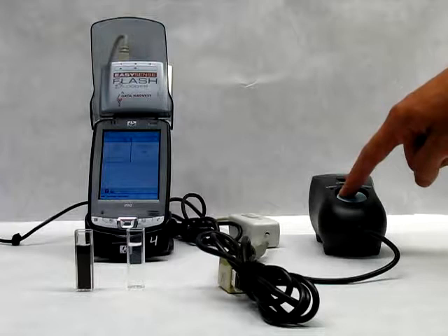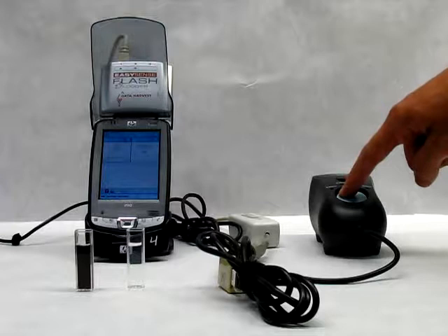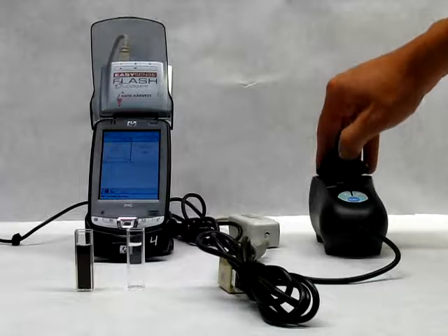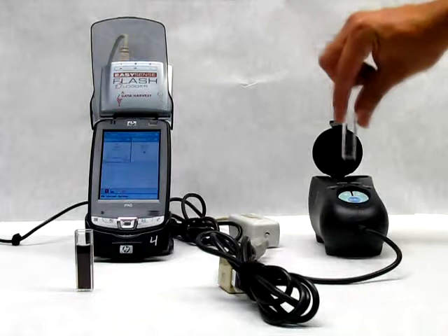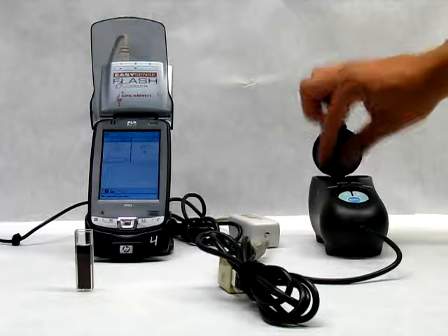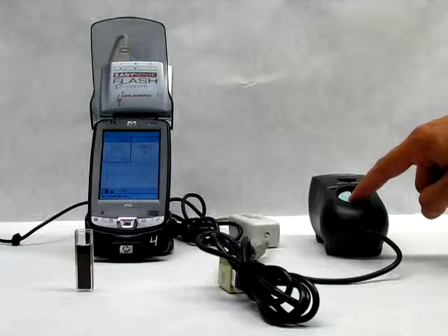You can see now the experimental setup. In front of the PDA, there are two cuvettes. One with the sample and one with the solvent, which will be our blank. First, we introduce our blank and then press the calibration button, which is marked with the letters CAL. That will set up the instrument at 100% transmittance.